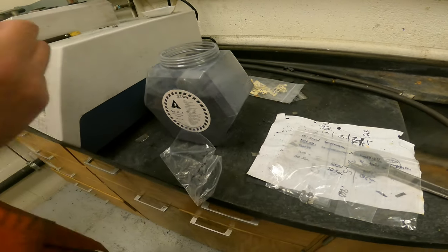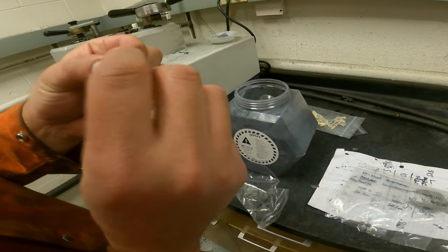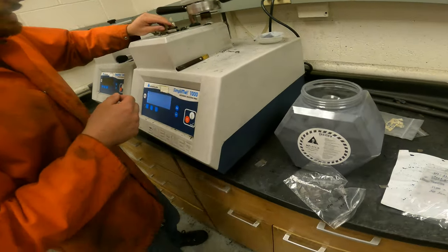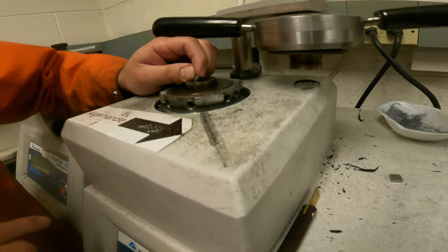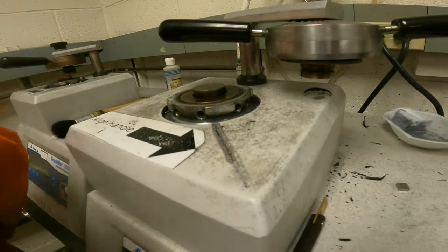So the first thing, you always need to check the surface. When you cut a sample, sometimes they have a little bit of extra chip that come from the cut, and they're kind of out of the plane. You want to see it like this. If it's a little at an angle, it's not properly touching. So usually what I do is I just file the surface.